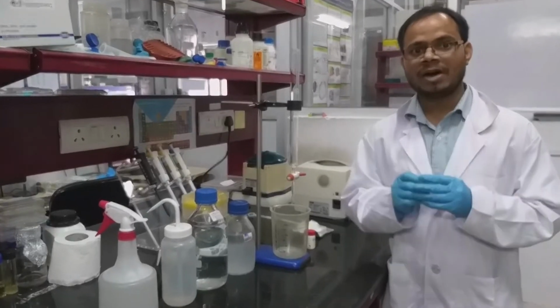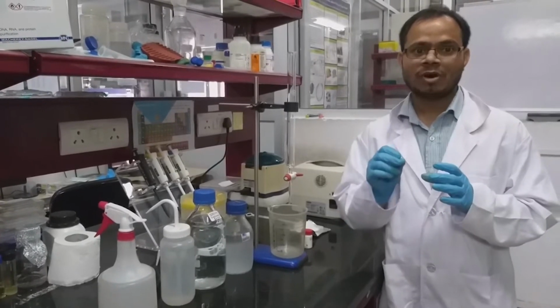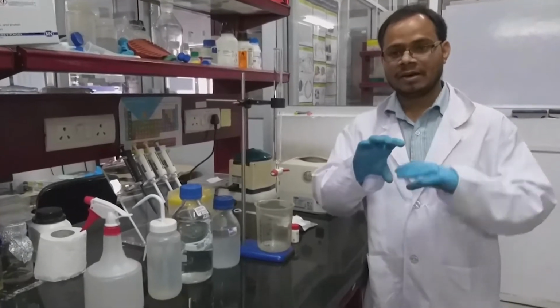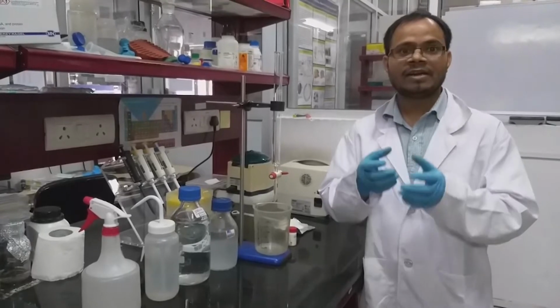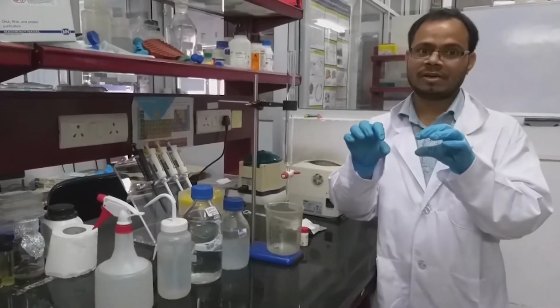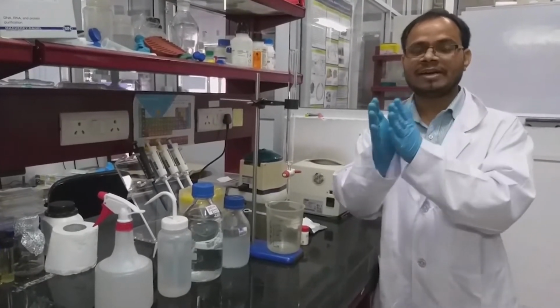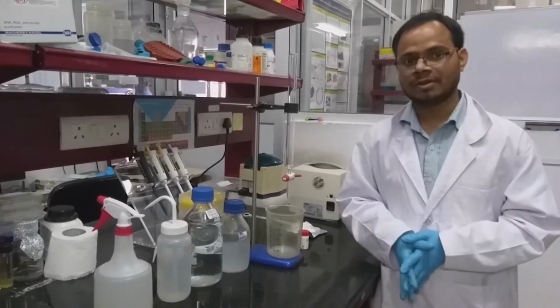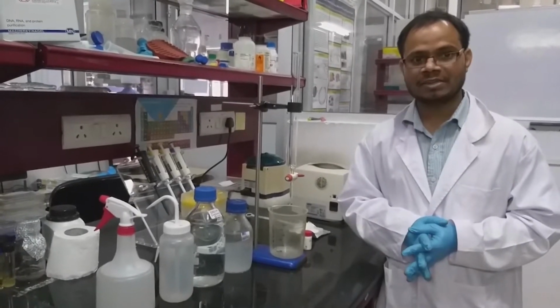The small molecule of 1 kDa will permeate or diffuse into the pores in the beads, and the bigger molecule of 200 kDa will be excluded from the pores. So it will elute first, and the smaller molecule will be retained, and we have to give sufficient buffer to elute it. This is the overall concept of gel filtration chromatography.